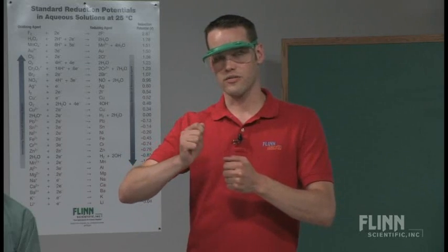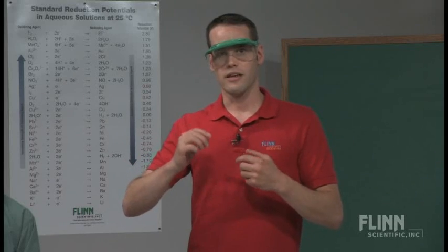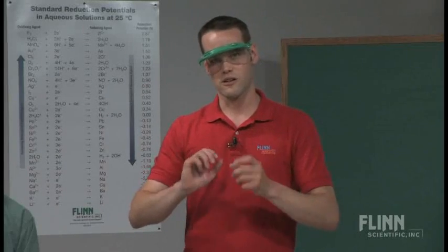You can do other variations of this too. If you want to turn this into an inquiry lab, give your students a burette filled with the sulfuric acid solution — 1 molar, or actually 0.1 molar tends to work better — and small cups of both the potassium iodate solution and the starch solution with the hydrogen sulfite in it. They can mix and see what happens by adding more sulfuric acid to change the rate of reaction. Then you can make it a competition: whoever gets closest to exactly 10 seconds for a color change wins — or closest to 10 seconds without going over for an additional challenge. They can play with the concentrations of the potassium iodate, the hydrogen sulfite ion, and the acid to see what all of these things do to this reaction.